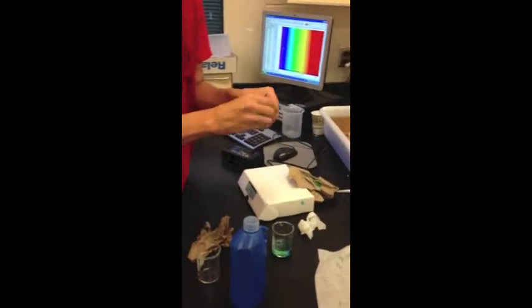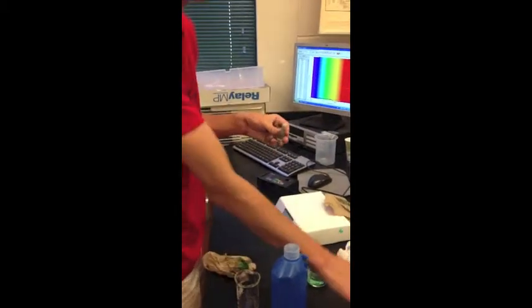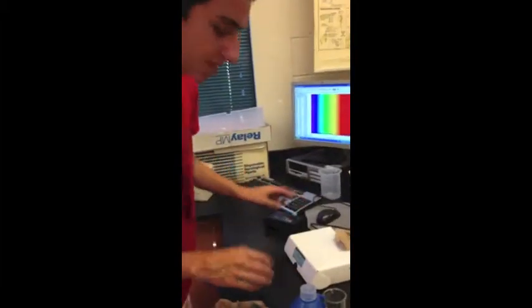Now, if you had to guess, which one would it be more like? That's right. It's probably going to be more like the green one because there was not much red food coloring used. So, last one. You know the drill. Alright. So, let's fill it up. Chem wipe. And put it in.